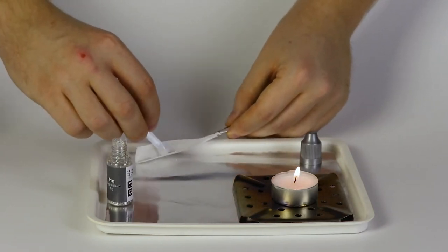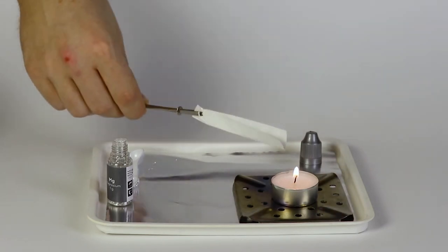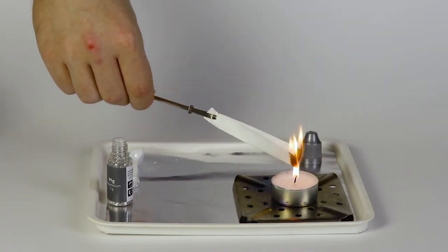Move the paper closer to the candle in order to ignite it. Magnesium will burn extremely bright.